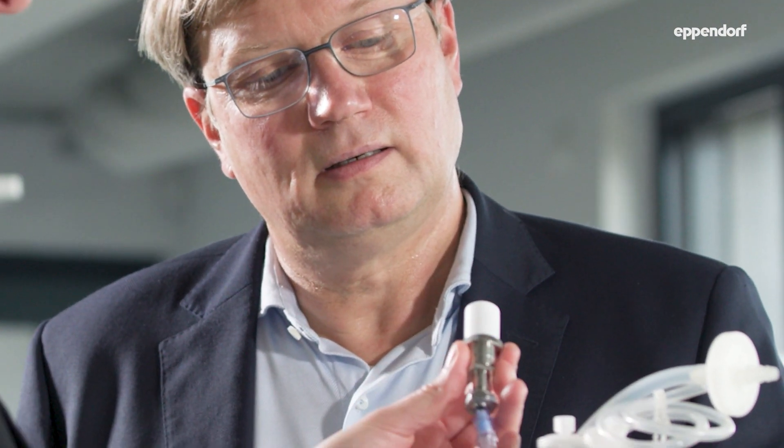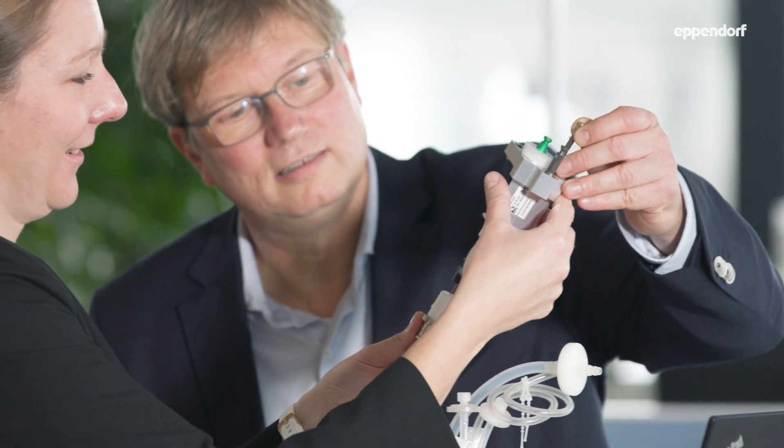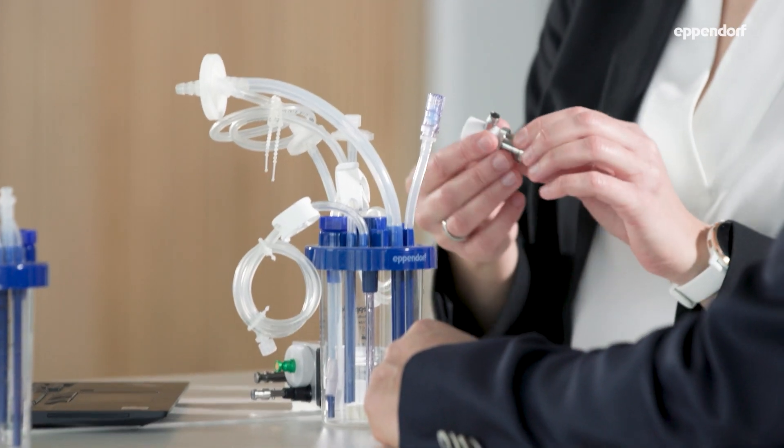It's kind of the missing link between the bioreactors we have today and the approaches we did within analytical device integration in our software package. I'm really excited that this opens up a full set of new possibilities and chances we have in the future.